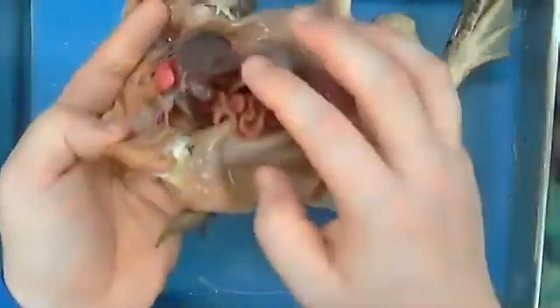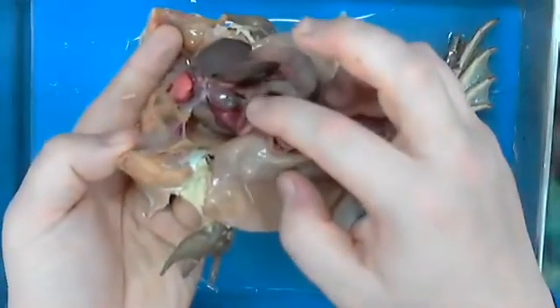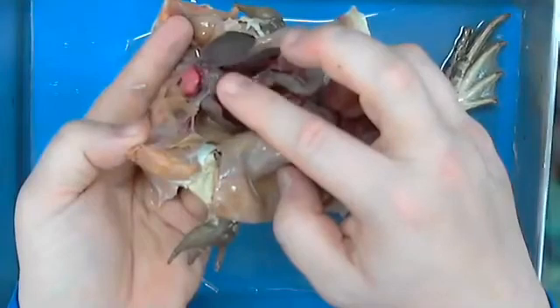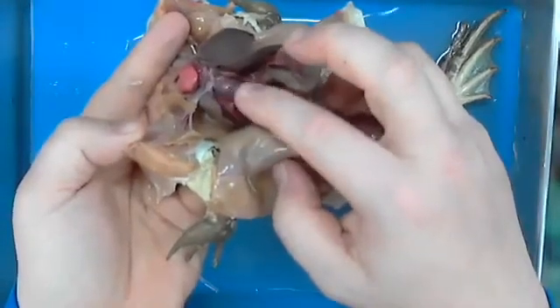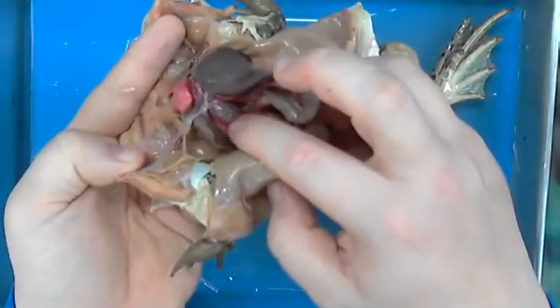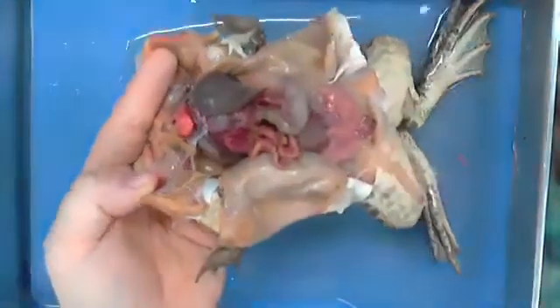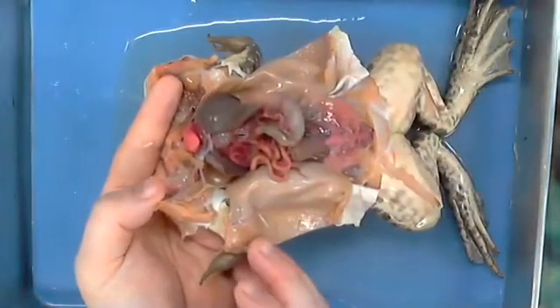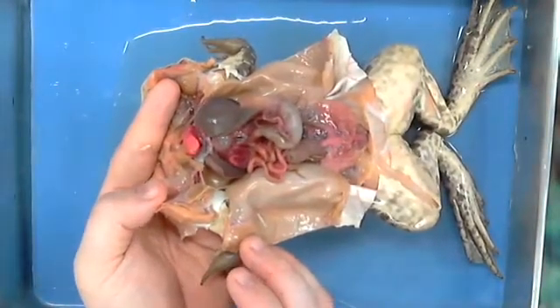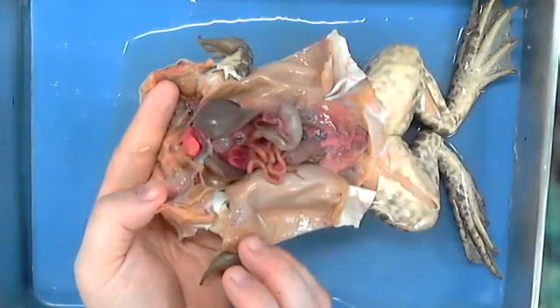All right, everybody look for me and see, what is this sac that is underneath the liver? Gallbladder. Oh, nice, a gallbladder. Excellent. So here's a gallbladder. What does it do? What's a gallbladder do? Some of you have had it removed. Its job is to store bile.